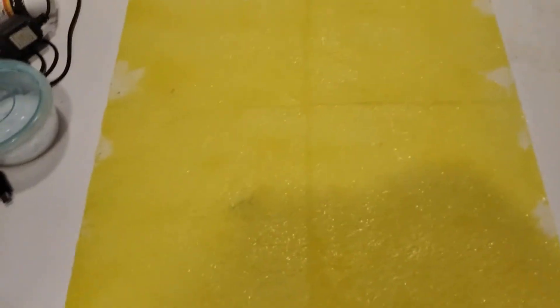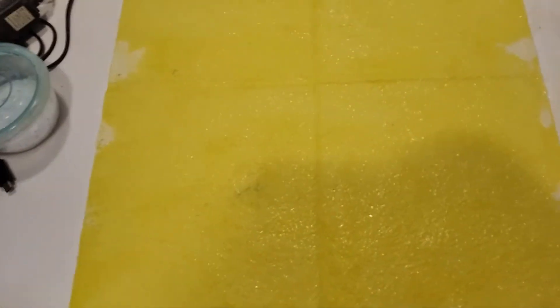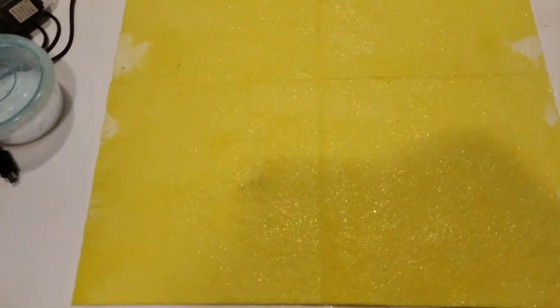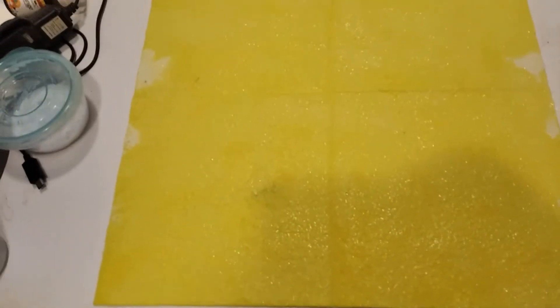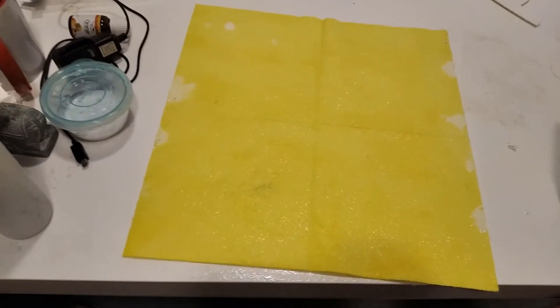Now what you want to do is flip this over, start painting, and start applying the spray again. After your first coat is done, you then dry it with a towel.